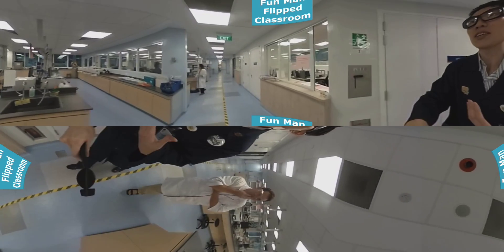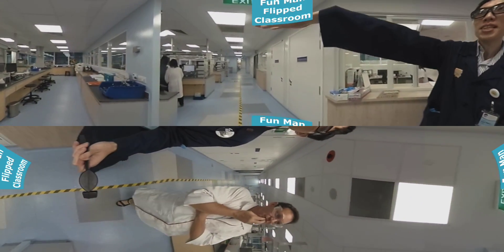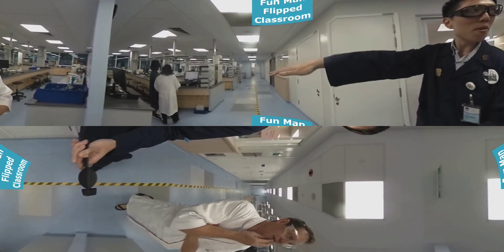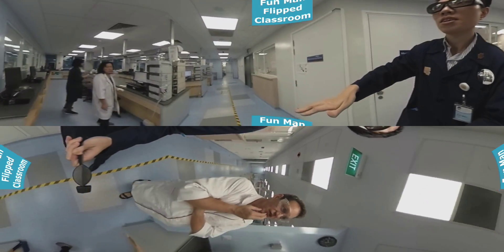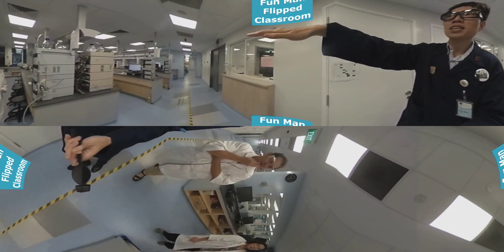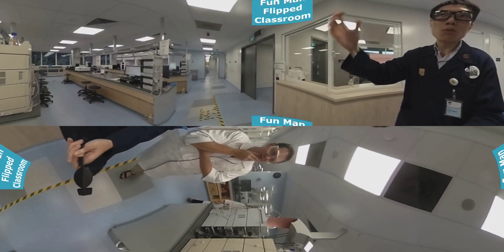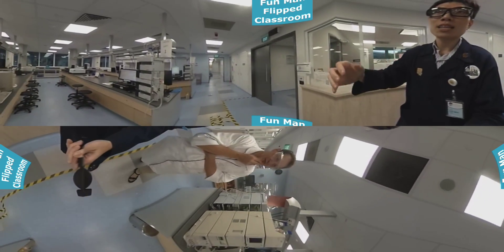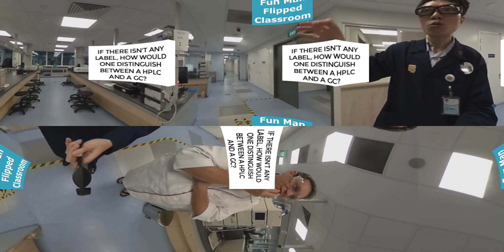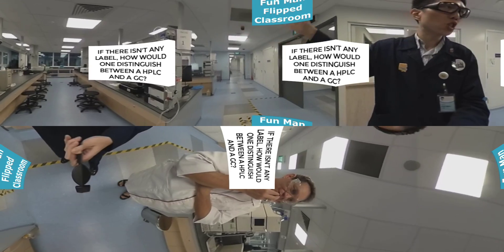Over here, we notice that in front of us, this is an HPLC system. Am I right? Yes, that's right. There are four or five HPLCs over here. And the first question I asked on day one was: if there isn't any label, how would one know that this is an HPLC or a GC?